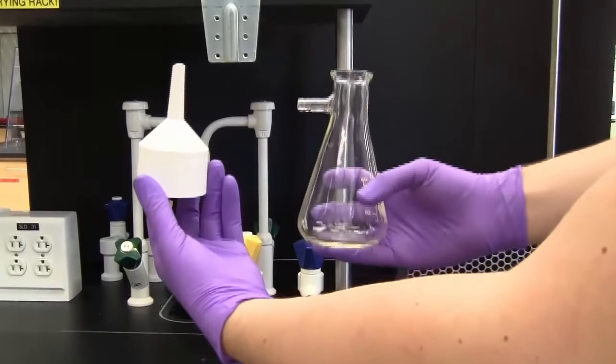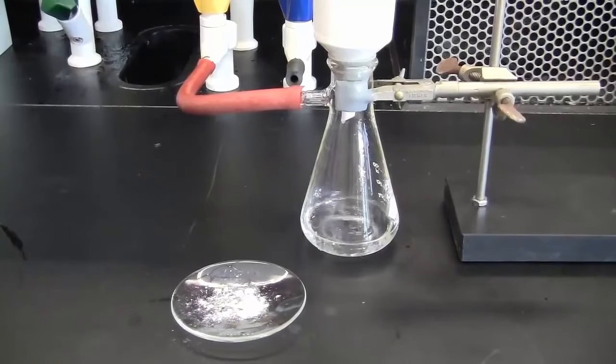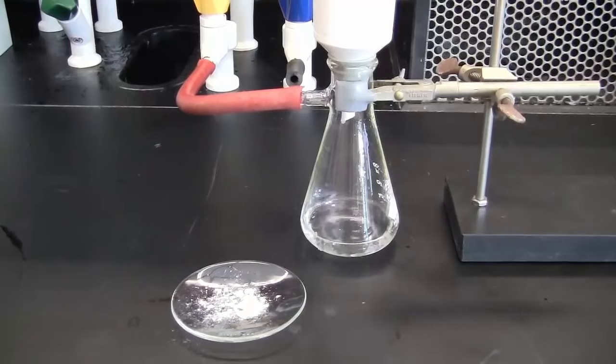To perform vacuum filtration, we will be using a Buchner funnel and filter flask. This technique allows us to separate solids from solutions.